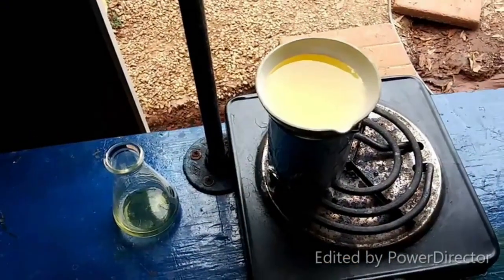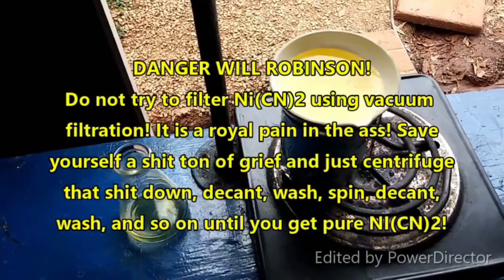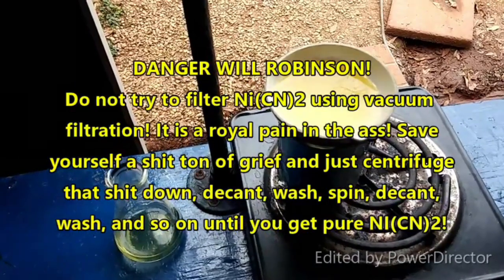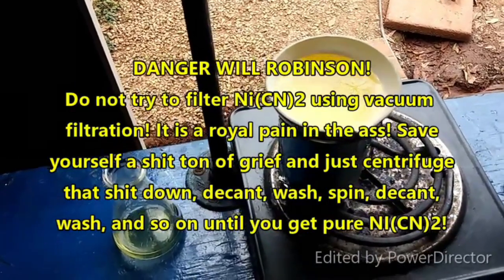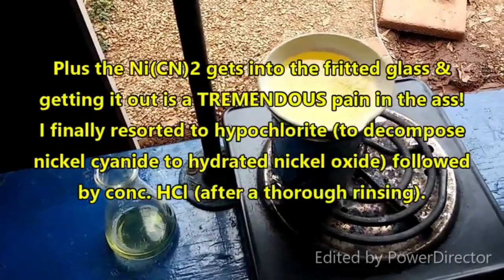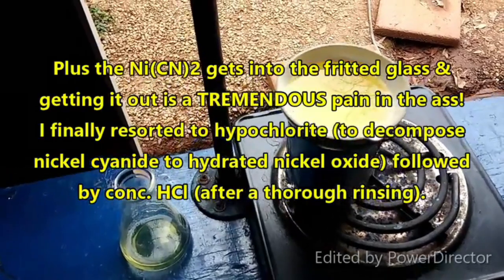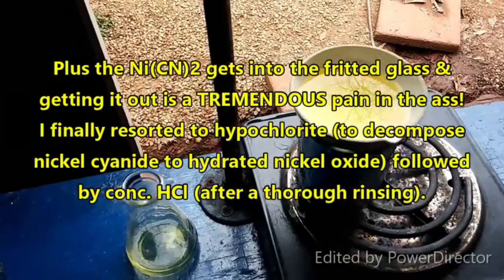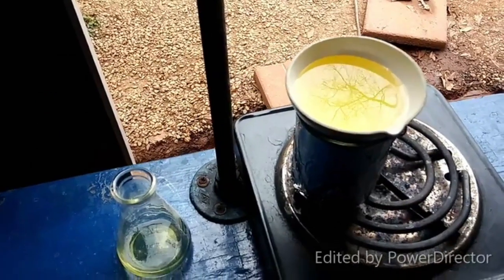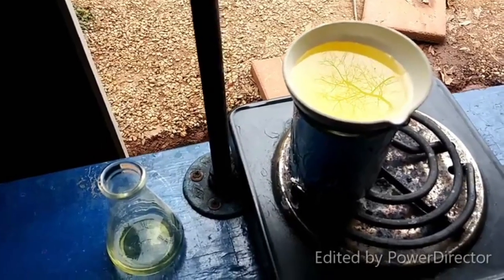Okay, everybody. Well, this went south in a hurry to the point where I very nearly scrapped this as a video altogether. The nickel cyanide forms, it must be extremely insoluble because it forms an extremely fine precipitate that clogged up my fritted glass funnel. It was terrible.